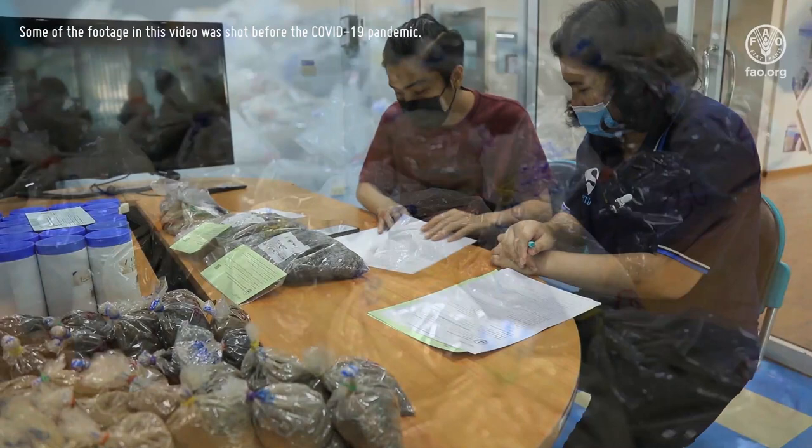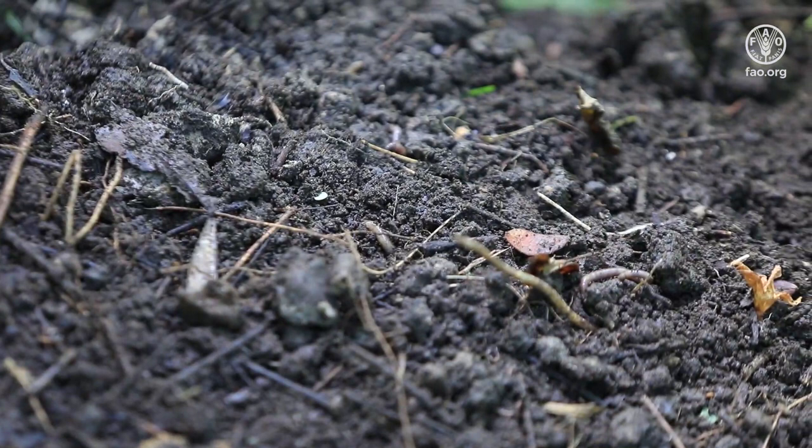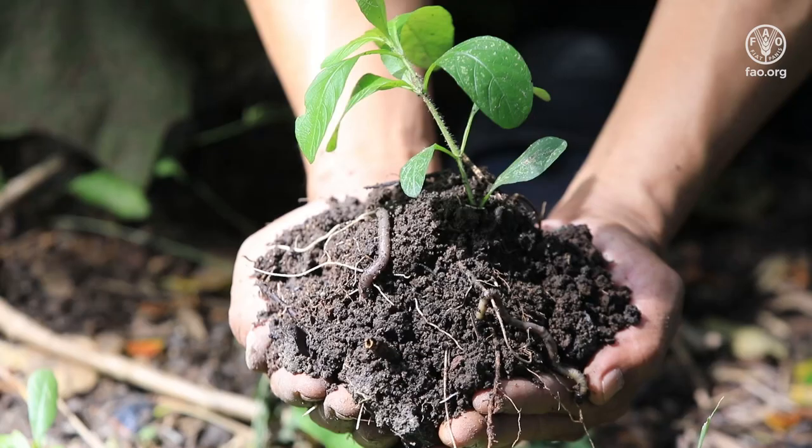Our services are for all stakeholders, farmers, researchers, private sector and universities. It is a pleasure for our laboratory to host this video, to show you how to determine soil organic carbon using Walkley and Black titration method.